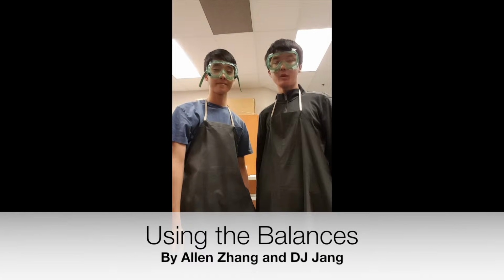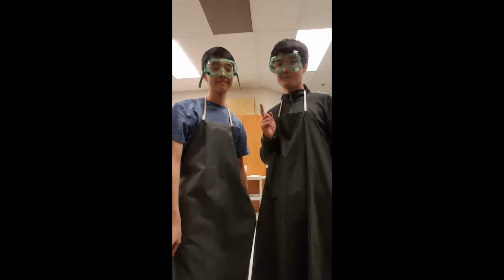Hello fellow chemists, today we're going to be teaching you how to find the mass of an object using two different balances, the triple beam balance and the electronic balance. And be sure, like other labs, wear your lab goggles, a lab apron, closed-toed shoes, long-sleeve pants, and if anything bad happens, be sure to tell the instructor.